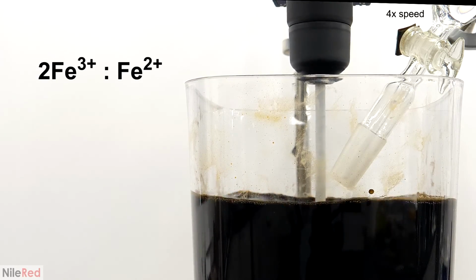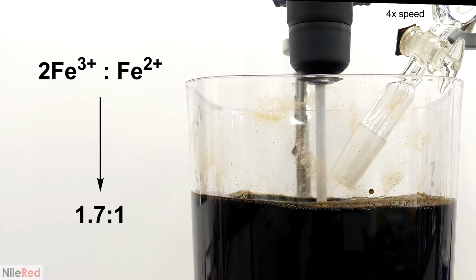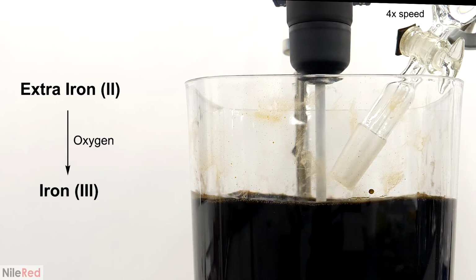What I did instead though was use a lot more iron 2, and I added it as a ratio of 1.7:1. This way, when it oxidized and became iron 3, it would then be able to just combine with some of the excess iron 2. This gave me a bit of a buffer zone, and it allowed the reaction to be a lot more tolerant to oxygen. However, when the reaction was done, I also didn't want excess iron 2 still floating around.